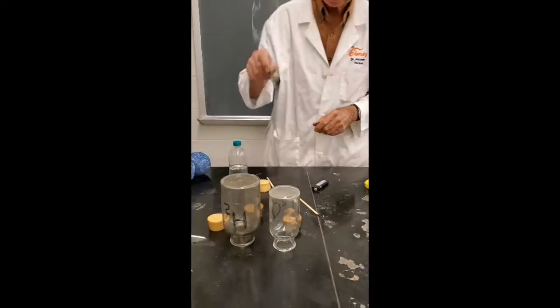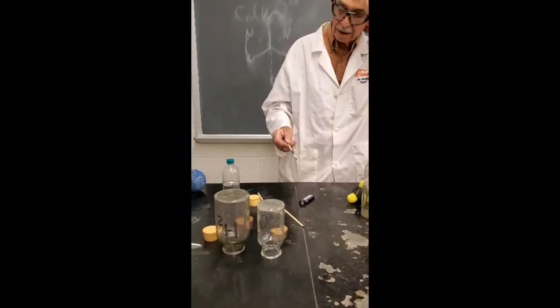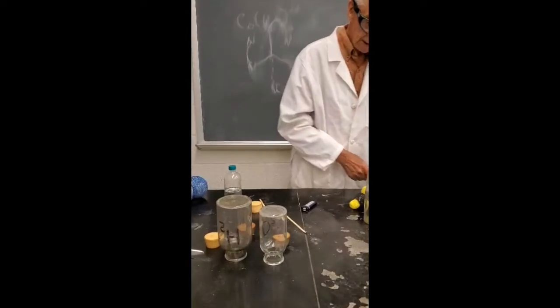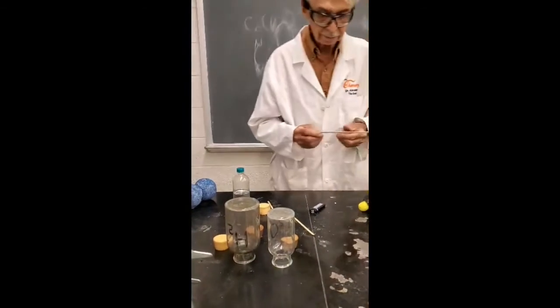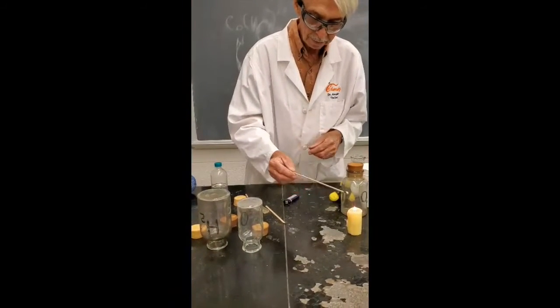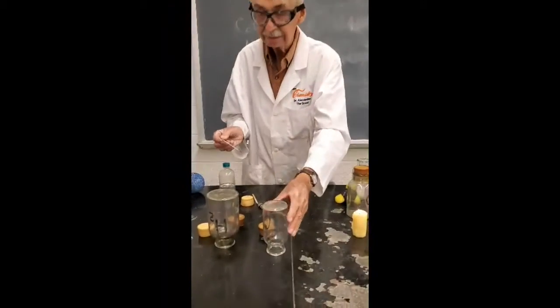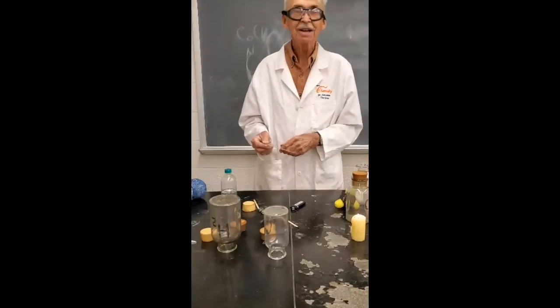Okay, now we should get an explosion. And since the mixture is lighter than air, I'll have those upside down. And I'll light the little one first, because that's the smart thing to do. That explosion will be not nearly as loud. Let's see. Did you hear the explosion?